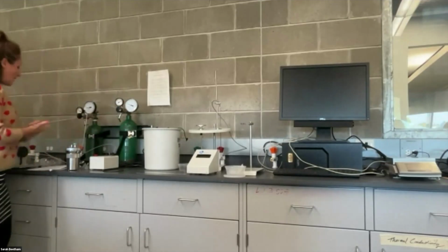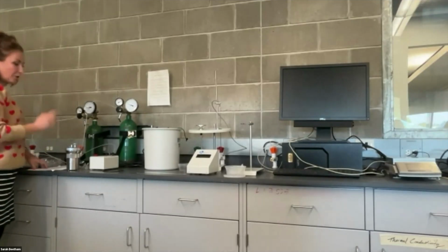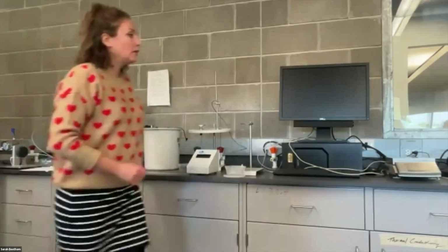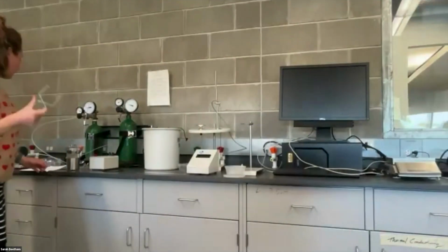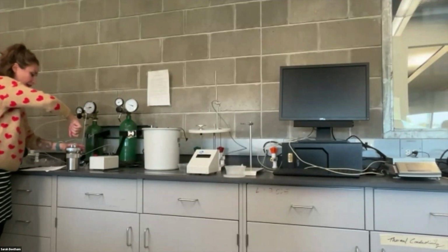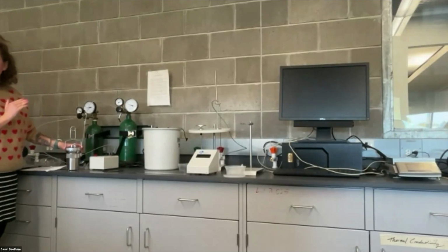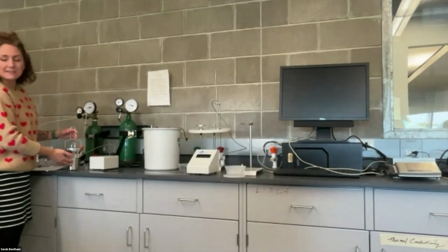Okay, so the next thing that we want to do is we want to put our bomb inside the water bath. We are going to do that using these tongs. So if you squeeze it, they open up, and there are little holes on the edge of this cap that this will fit into. You're going to want to be very careful when you're doing this so that we're not disturbing the sample inside here. Obviously we can't see it anymore, so we want to be careful that we're not messing it up just in case. And also just so you're aware, this thing is pretty heavy.